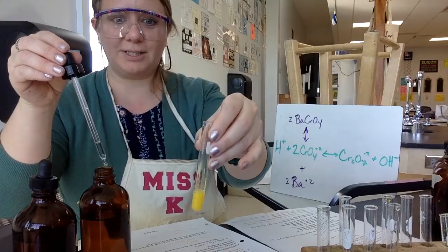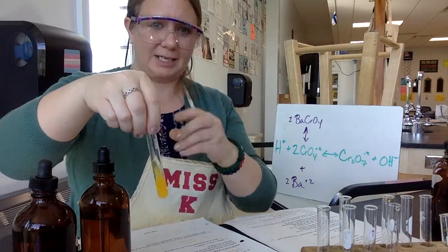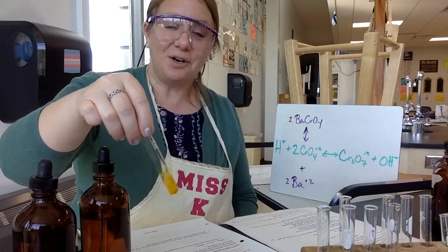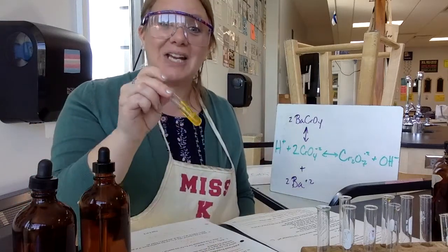What do you see? What's going on? What does it look like? Add just a little bit more to make it just a little bit more obvious. All right, look at that. Cool chemical reaction. Oh my gosh, it's so neat. I love this. Okay, let's talk about what happened.